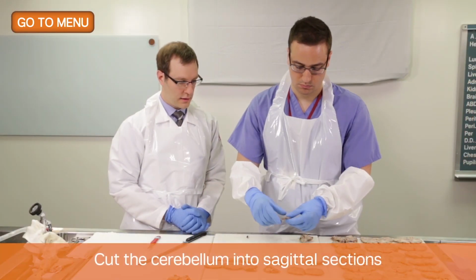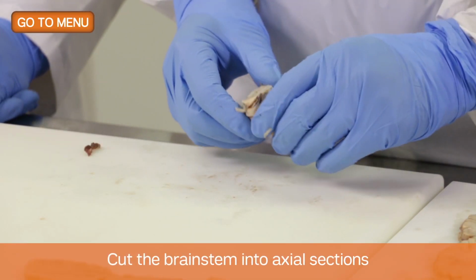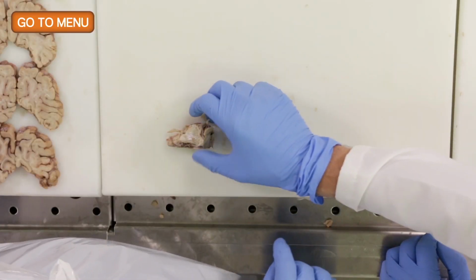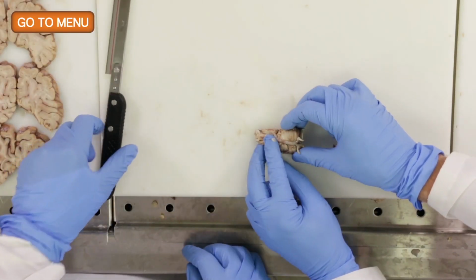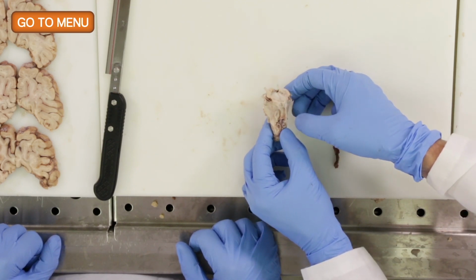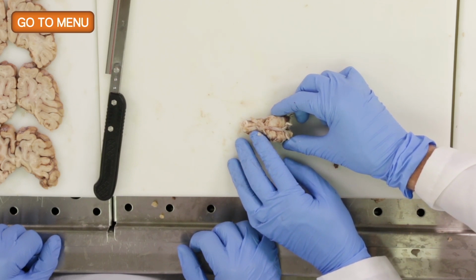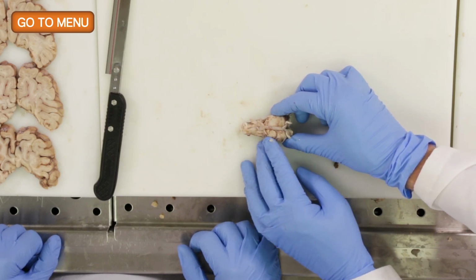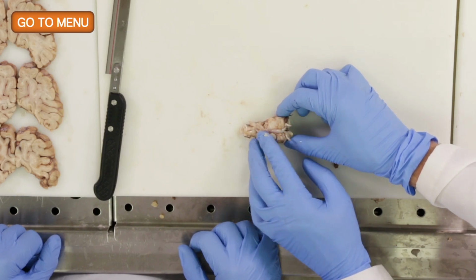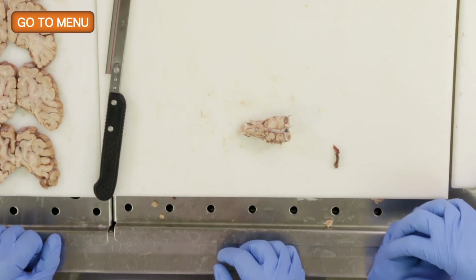Okay, great job. So now we're going to cut the brainstem axially rather than sagittally. And I find that oftentimes it helps to rest the brainstem on the posterior aspect, so where the fourth ventricle is, and it's easier to make it stable. If the vessels are too calcified, oftentimes I'll just remove the vessels, unless there's a particular reason I don't want to do that. But sometimes I'll just remove the vessels to get cleaner cuts to the brainstem. In this case, I think you could probably just leave them there.